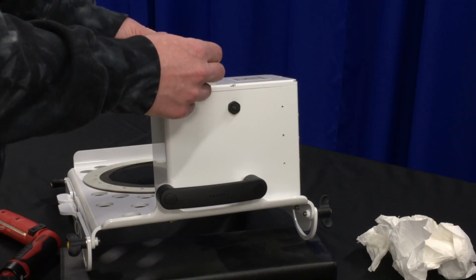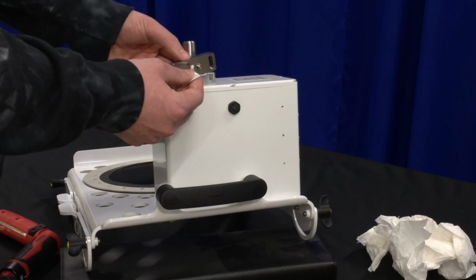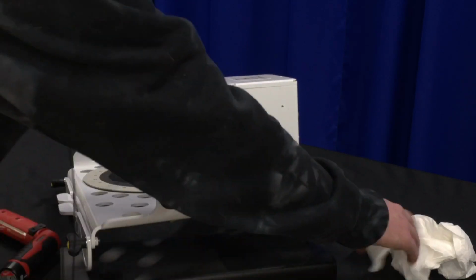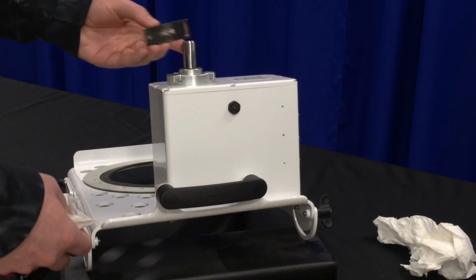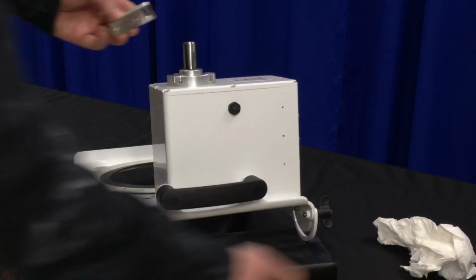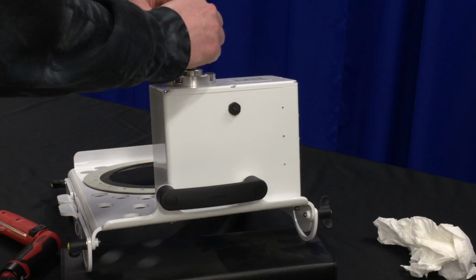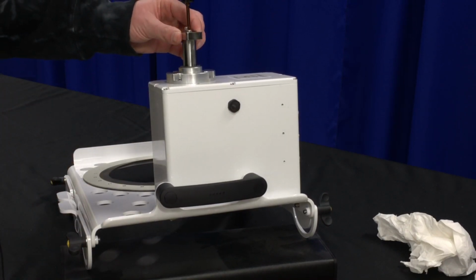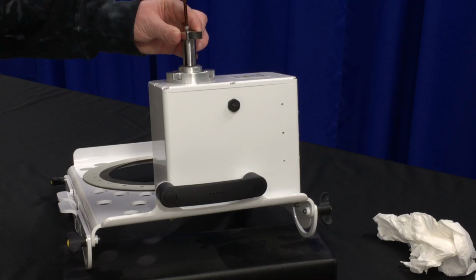We'll apply the Loctite to the column adapter bolts. And then be sure to clean the surface of the column itself if it's not. And these will require a lot of torque.